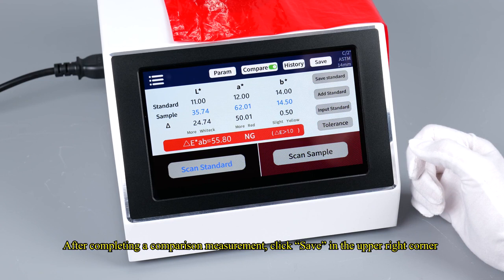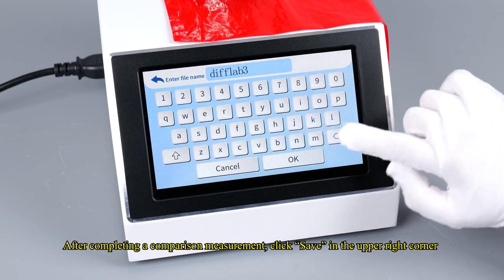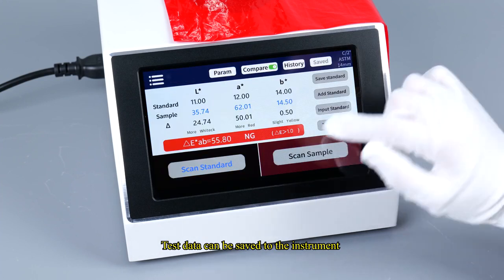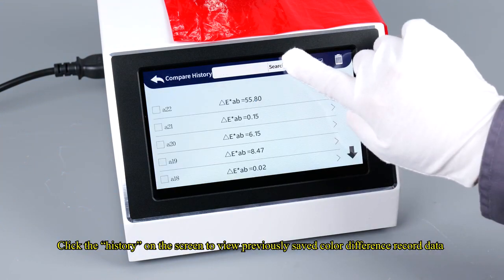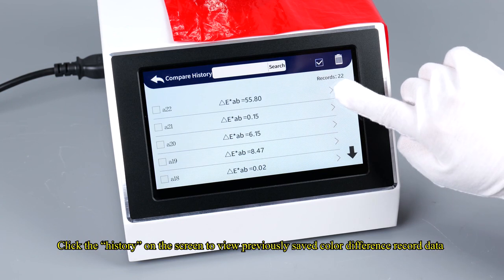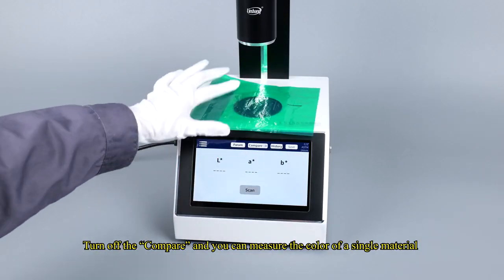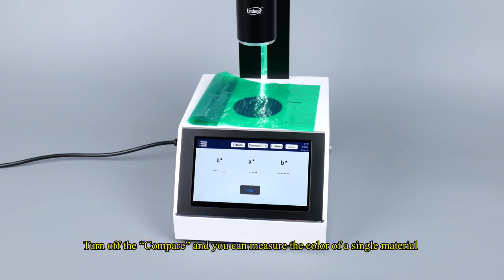After completing a comparison measurement, click Save in the upper right corner. Test data can be saved to the instrument. Click the History on the screen to view previously saved color difference record data. Turn off Compare and you can measure the color of a single material.